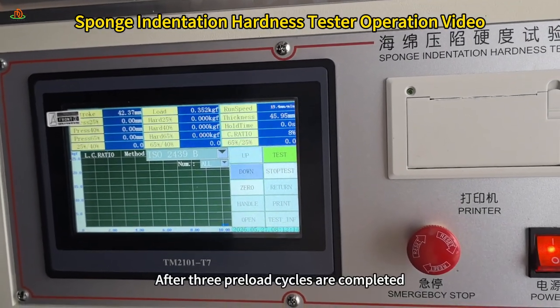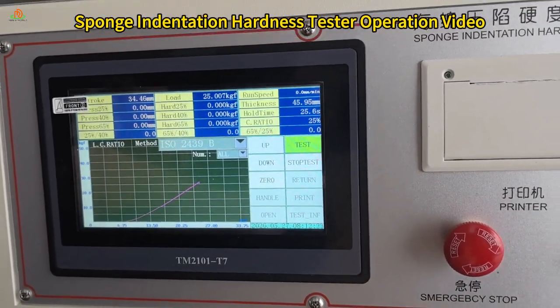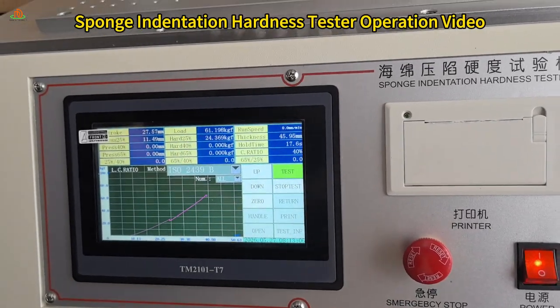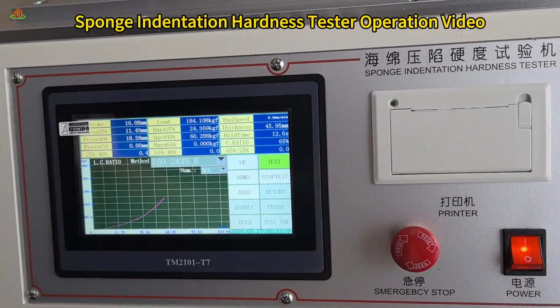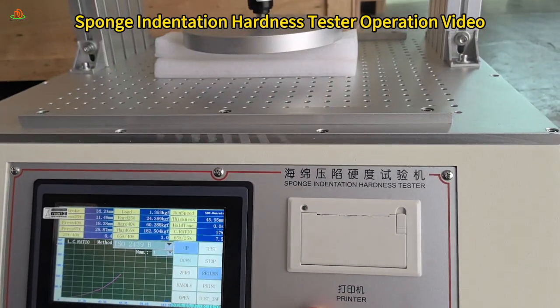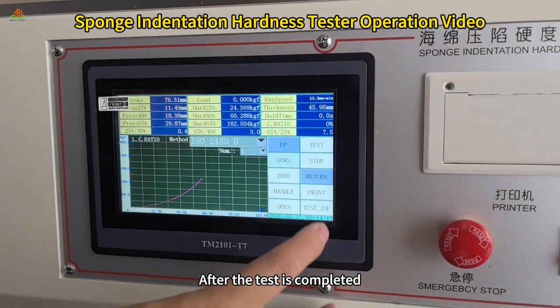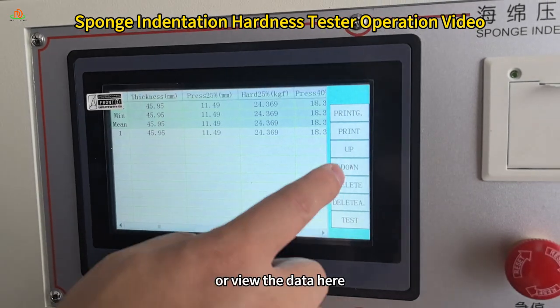After 3 preload cycles are completed, the curve will appear here. After the test is completed, click the Print button here to print the results, or view the data here.